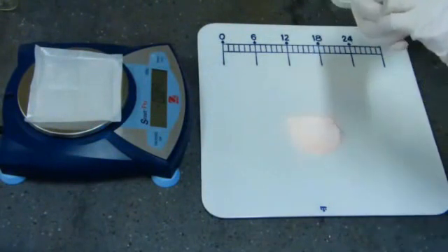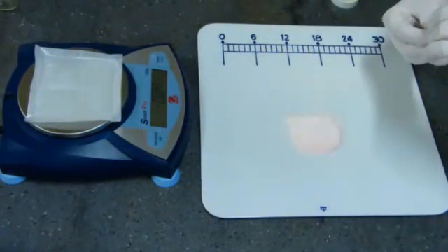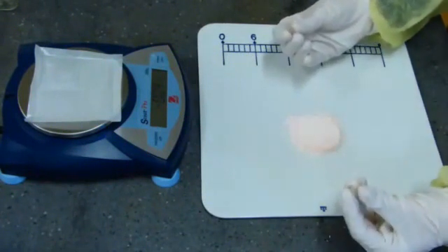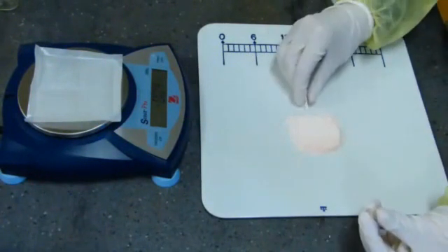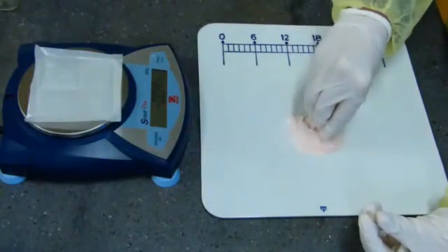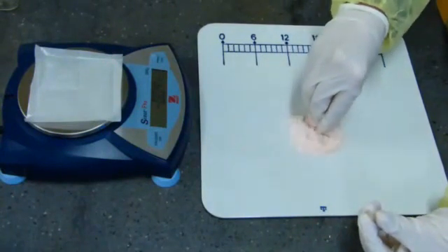Always punch the powder into the body of the capsule, not the head. The powder should never be poured into a capsule body. However, it is permissible to initially scoop some powder into the capsule, then punch the remainder of the powder into the body using a firm, even motion.